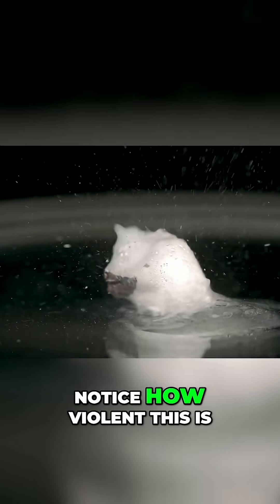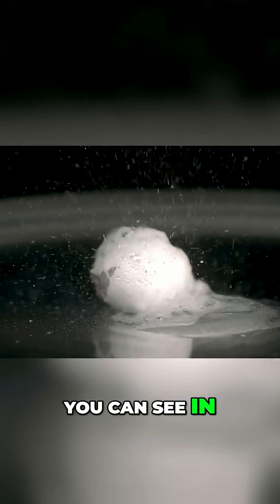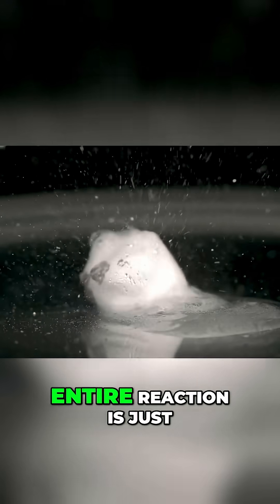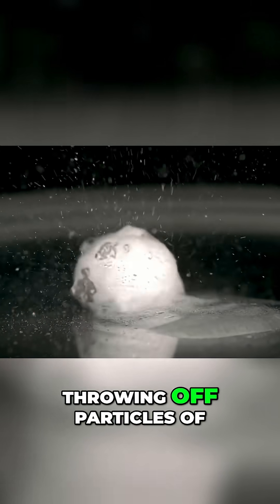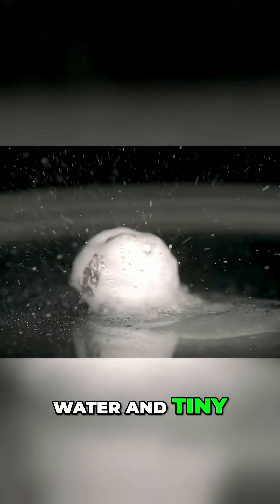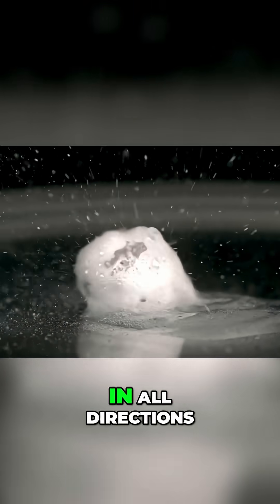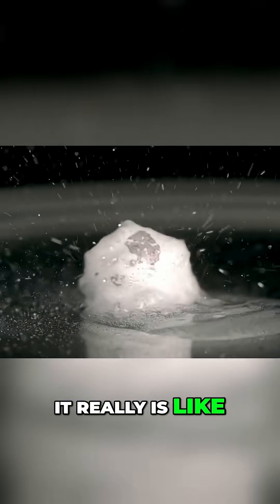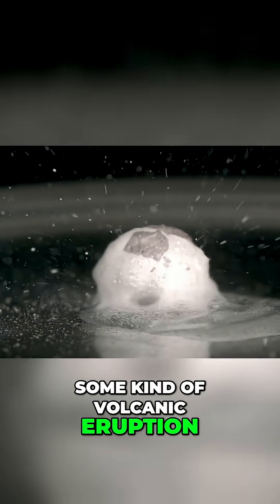I want you to notice how violent this is. You can see in slow motion that this entire reaction is just throwing off particles of water and tiny, tiny chunks of sodium in all directions. It really is like some kind of volcanic eruption.